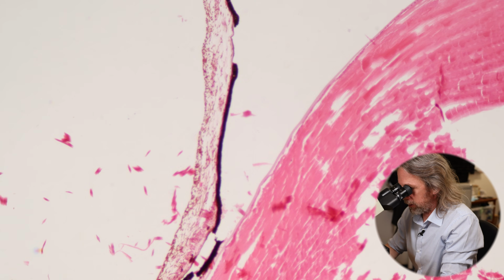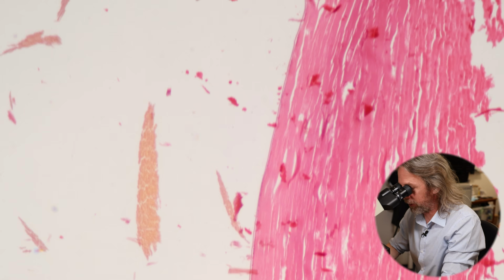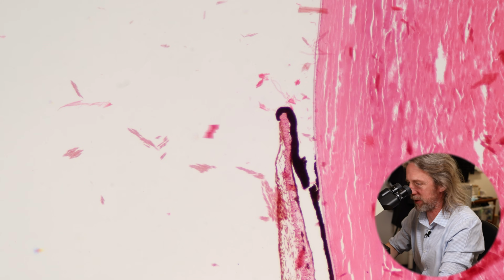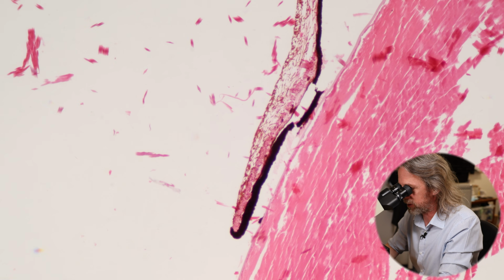Okay, let's have a look at the iris first. The pupil's pretty easy to look at, right? It's nothing. The pupil is the gap, the hole that the iris goes around, the hole that lets light pass through. It's just black because the inside of the eye is black. Right, so there's the iris.